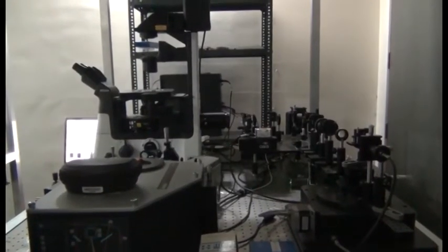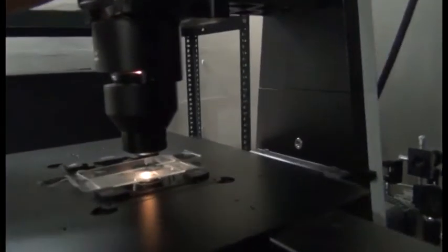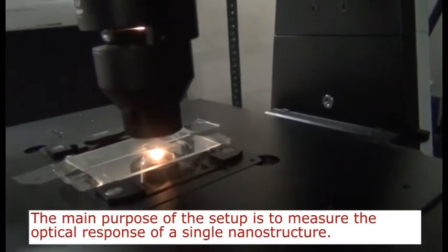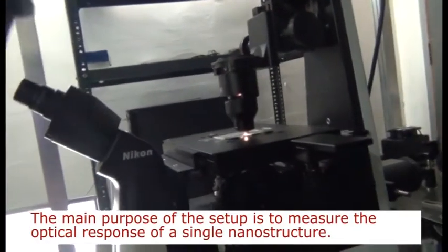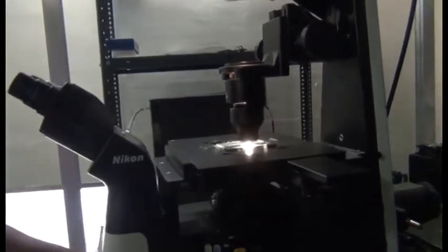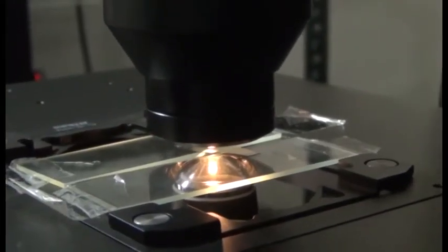The way this setup works is twofold. One is the excitation part of geometry and the other is the collection part of geometry. In the excitation part, a white light source, in this case a halogen lamp, is directed through a series of lenses and a dark field condenser, which makes a cone of light that then illuminates the sample. The cone of light illuminates the sample, and because of this there is a scattering of light by the structure present on the sample surface.